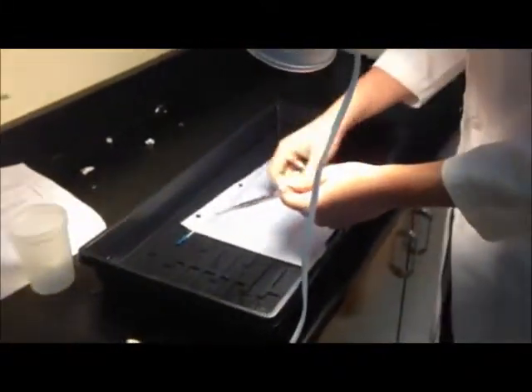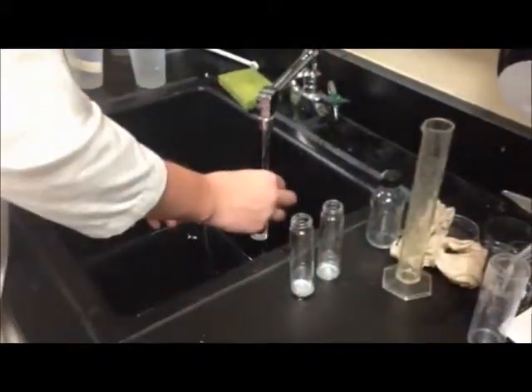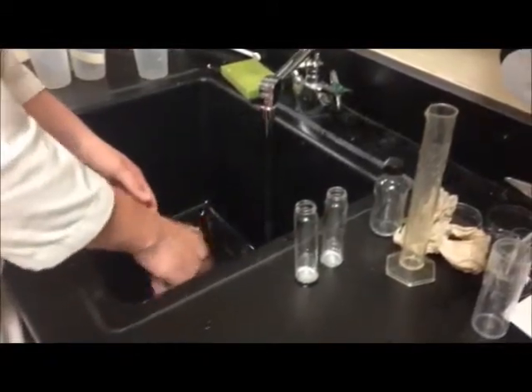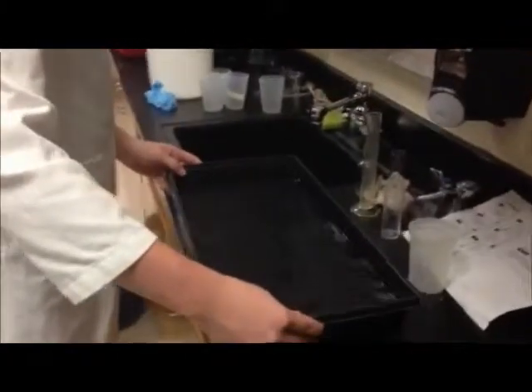Then in order to use the data collected in the lab, you use the control, take the data collected by the peas, and subtract the control or the beads.